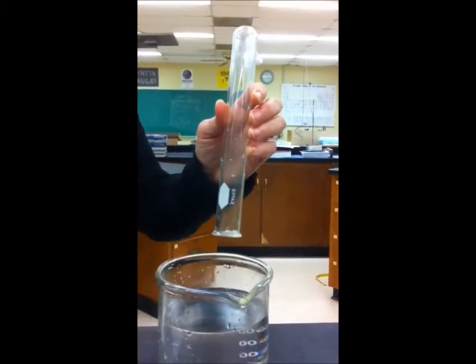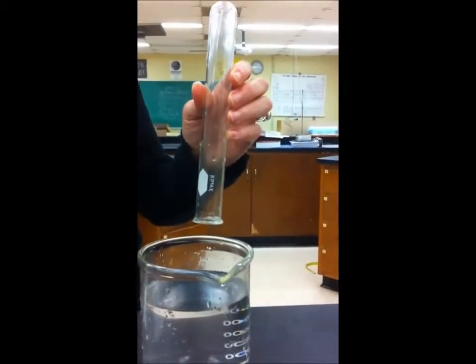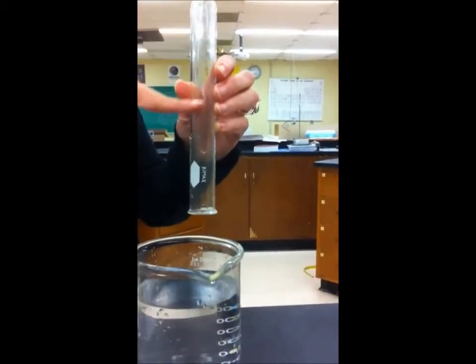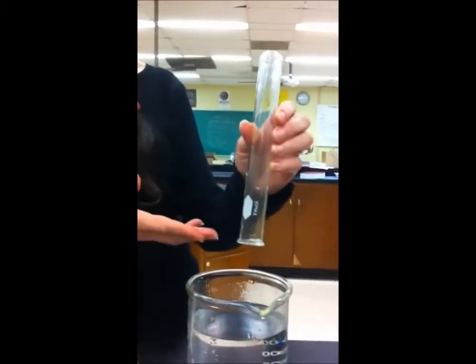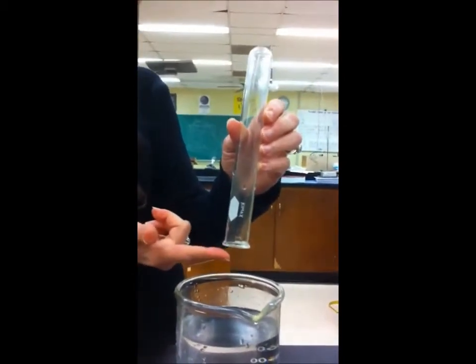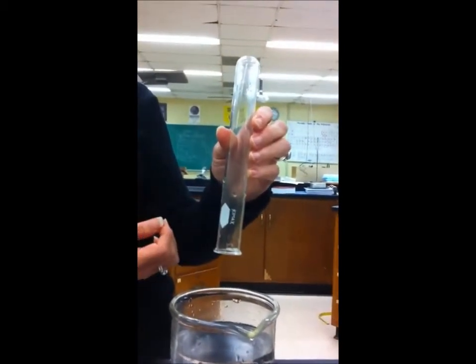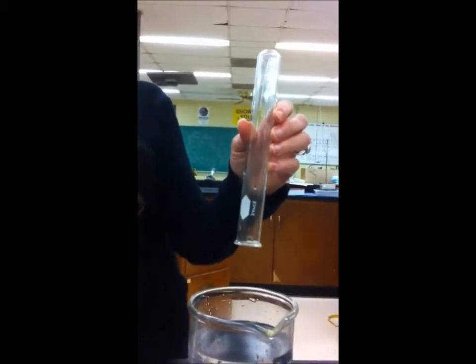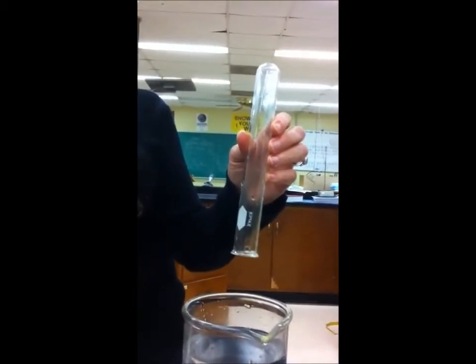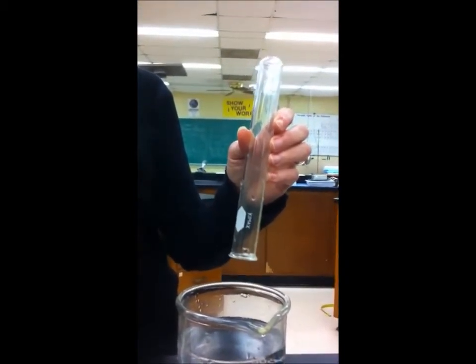Awesome. So what just happened is the sodium oxide that was in there was the cloud, and the cloud went down as the flame ate it up. The flame stayed in the mouth of the test tube while all of that sodium oxide was eaten up. It's reminiscent of the flame test that we did earlier in the year. So this was a spontaneous combustion using just sodium and water.